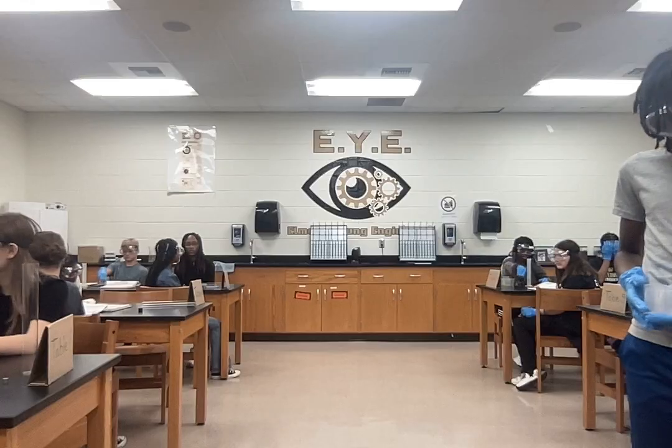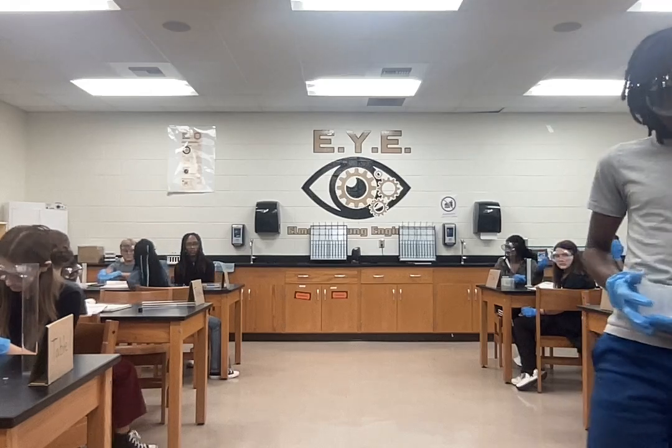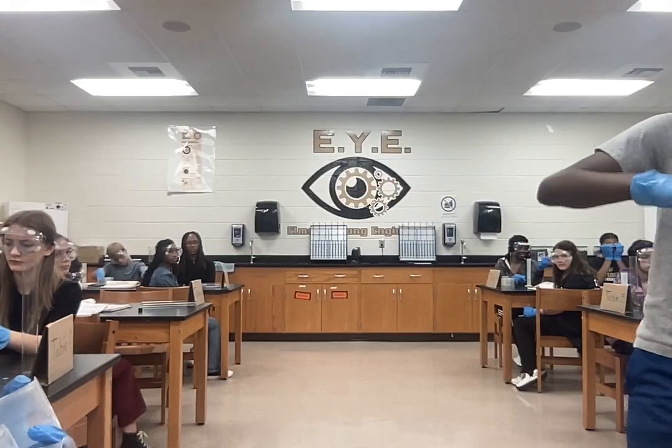If you have water in your graduated cylinder, Haley's group, y'all only need 25, so someone remeasure that for me. But the rest of you can put 1 drop of food coloring in that graduated cylinder so that your water is colored. Now, if you don't have food coloring at your table, give us just a moment because they only send you with 4 colors in a box and we have 6 groups. So, we'll sit this down and we will measure out 25 milliliters. Okay?